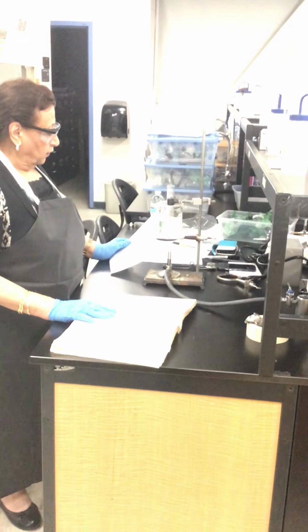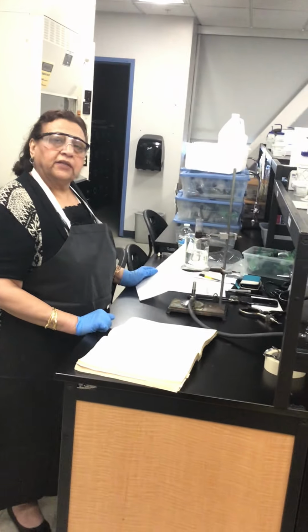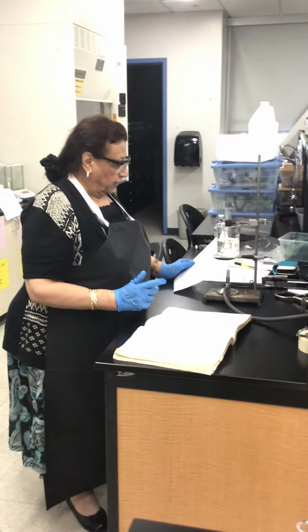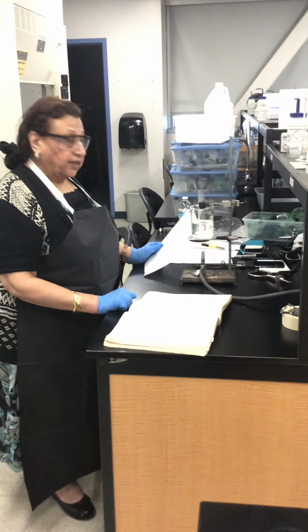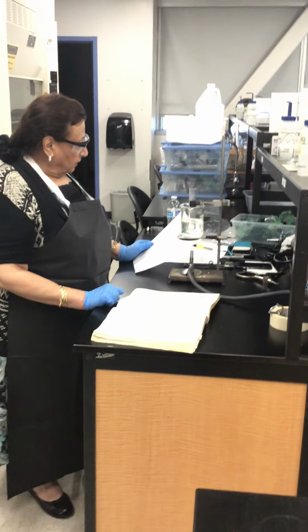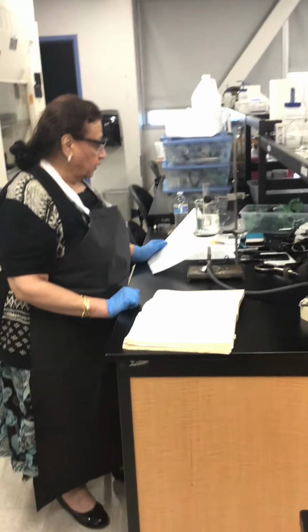Mass 24.4 gram, test tube only. Test tube plus lauric acid, I added about 4 gram of lauric acid. So the test tube and lauric acid came out to be 28.51 grams. And then for the mass of lauric acid by itself, we subtract both from each other.